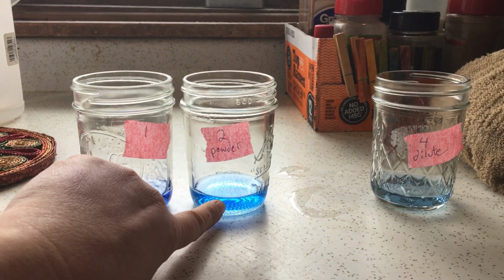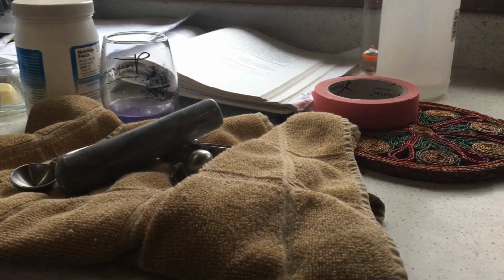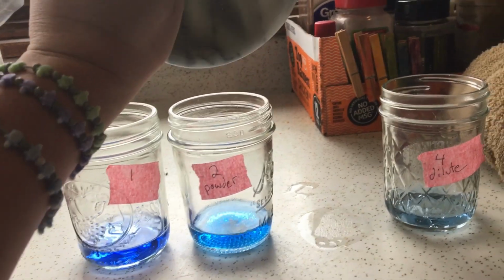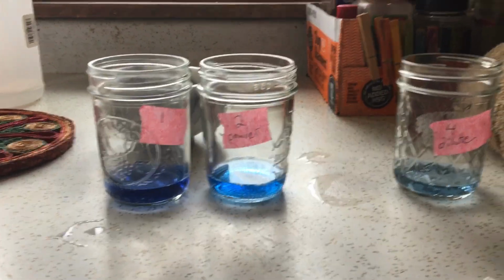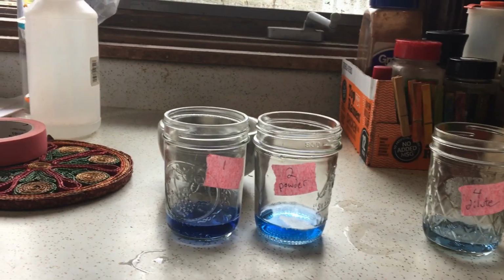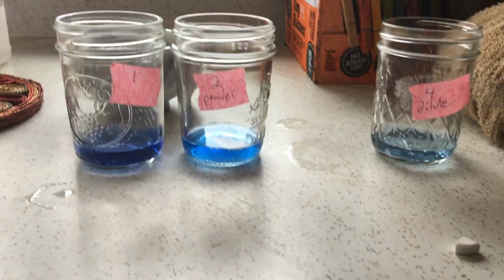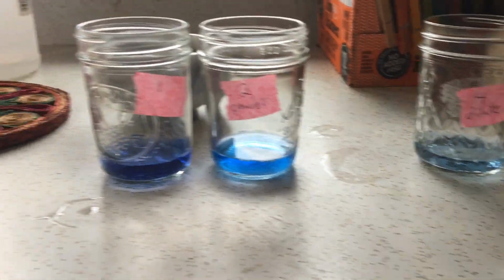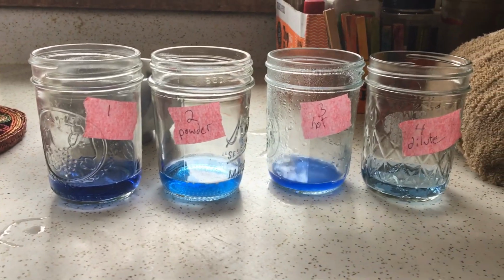Number 2 is going to have the same amount of toilet bowl cleaner, but we're going to change things up a little. And I've already powdered this. This is 1/4 antacid. Definitely gonna have to put down my phone to get that in there. It has a greater surface area because it's been powdered. Okay. Number 3 is hot. I think I'm gonna need some hot pads to pull that out of there. Same thing as test tube number 1, except this is going to be hot toilet bowl cleaner. All right. Again, we're going to put a 1/4 tablet in there in the hot.